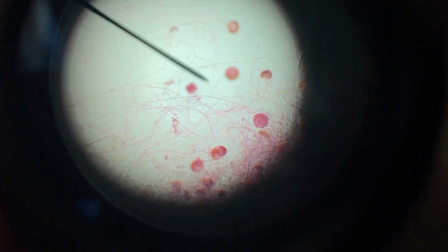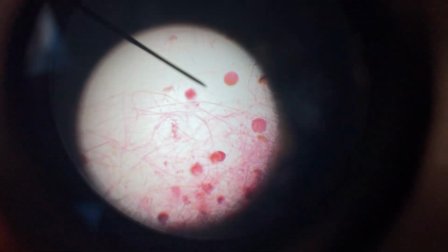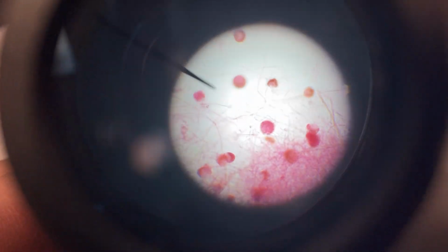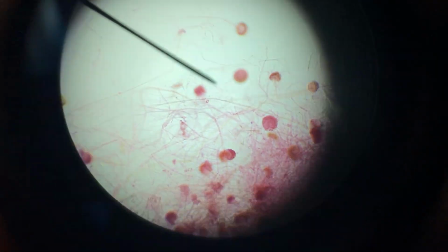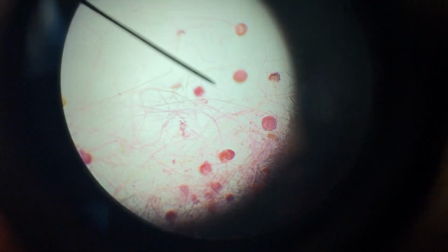This one's giving me trouble. The sporangia are those big red balls on the ends of the sticks. There we go. You see all that mess of sticks? Those are all the hyphae. And on the ends of some of those are those big sporangia, which is where the spores are. So they look like nice big round balls with little lines connecting them all together.